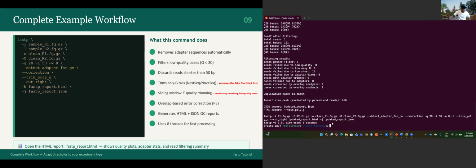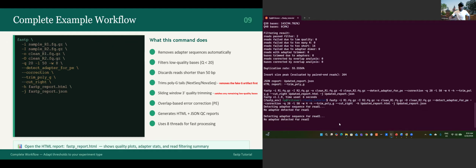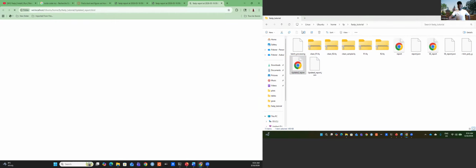But when I double check the script, I didn't do anything wrong. It's just the same report.html. Okay, I think I see what I did wrong. I'm sorry. I think I removed the -h that's meant for HTML. Now it should work. Okay, yeah, now it says HTML report generated. Let's just give a quick look. Voila. I got it.